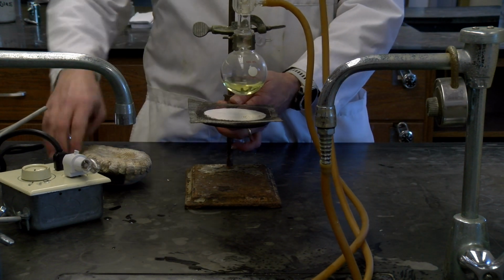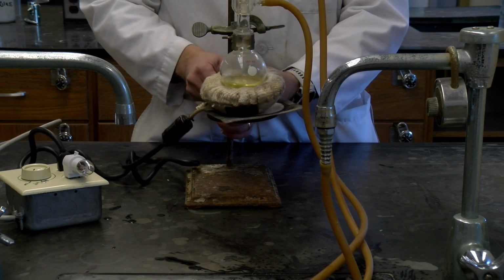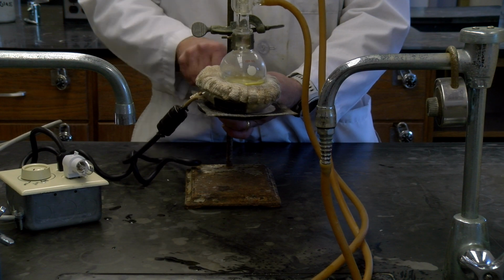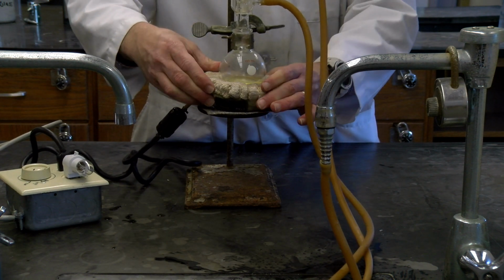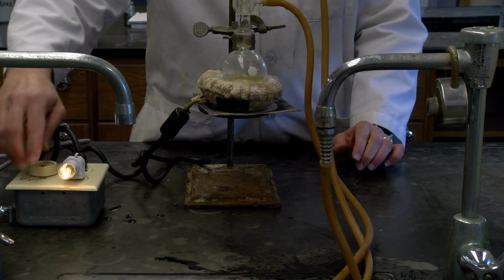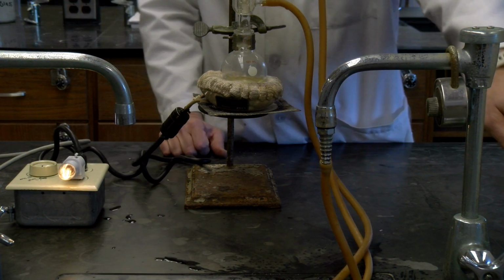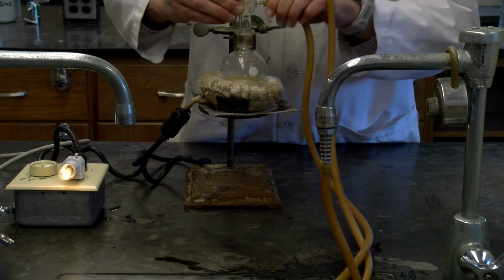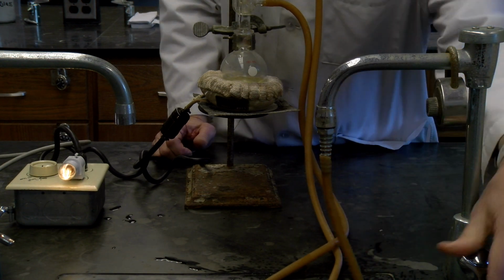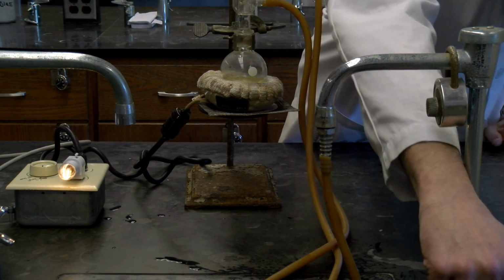I'm going to drop this down just a little bit and then raise it back up so we have a nice tight fit here. That's underneath. Again, the manual talks about using high heat, so we want to go all the way to the brightness of the bulb. And so we're going to heat this up. We also, at this stage, make sure our tubes are connected. Hopefully they're all going to stay on. And we just need a little trickle of water that's going to run through this.